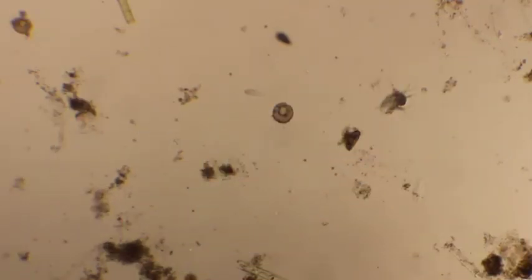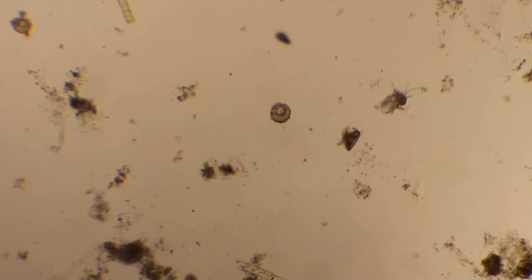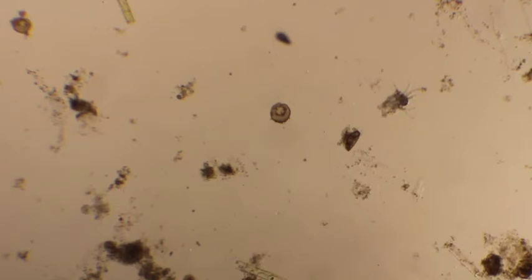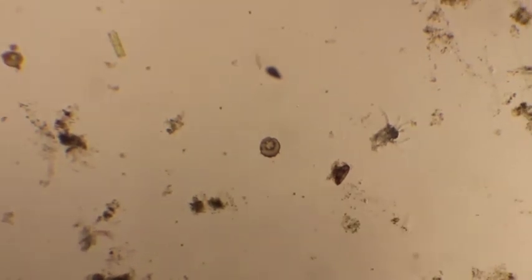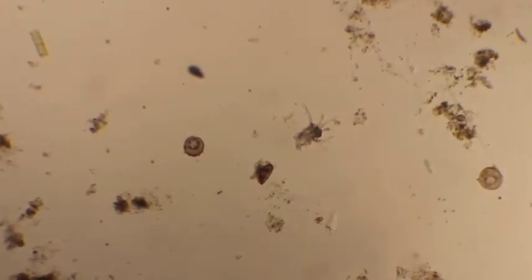This is our amoeba slide. We're right now under the 4x objective, so it's magnified 40 times. Amoebas are interesting. They're single-celled organisms, and they're actually quite large single-celled organisms, and they're very slow-moving. The key to finding an amoeba is knowing what you're looking for. Okay, in here there are actually two different types of amoebas on this particular screen. Amoebas move slowly, and they expand out with long finger-like projections called pseudopodia.